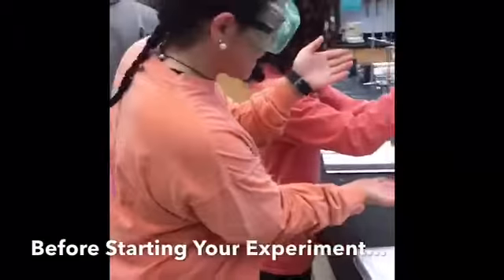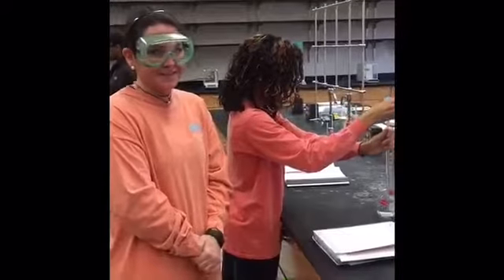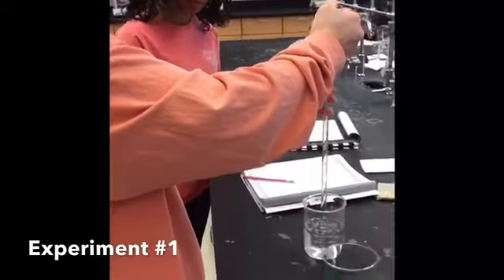First, you have to rinse out your pipette 3 times before your experiment. A meniscus is the curve in the upper surface of a liquid close to the opening of the container or object. This occurs because of surface tension in the glassware.